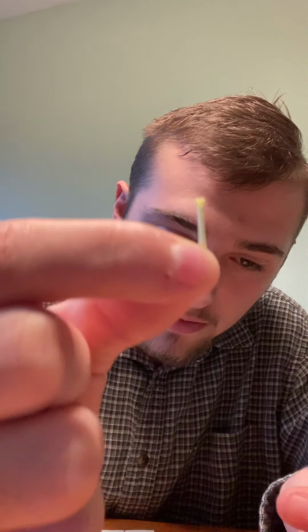Now we are moving on to the stigma. The stigma, I cut out of one already, but it was in the direct middle of the flower. Right here. You can tell that this one is the stigma, not a filament, because of its top. And the style was down, and I'll try to get a better angle on it.